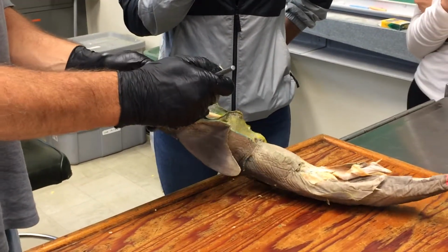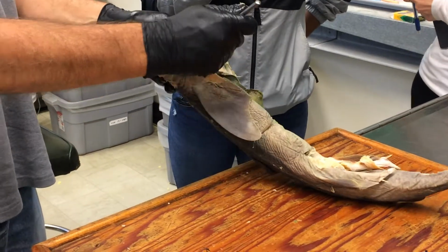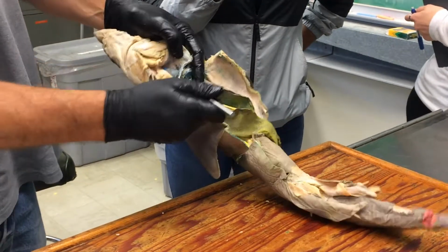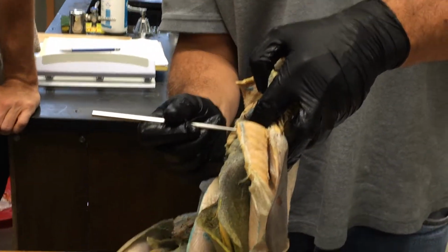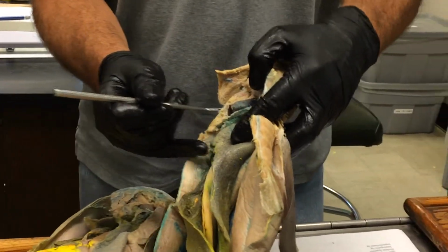there's two parts of the ventral mesentery. One part runs from the liver to the ventral body wall. And that can be seen right here in the midline of the liver. It's been cut off the ventral body wall, but right there. And that would be called the falciform ligament. So that's this thing right here. Okay. Well, that's the falciform ligament.